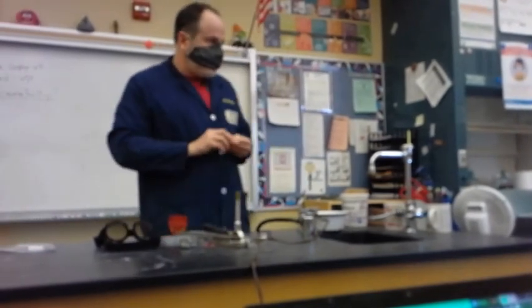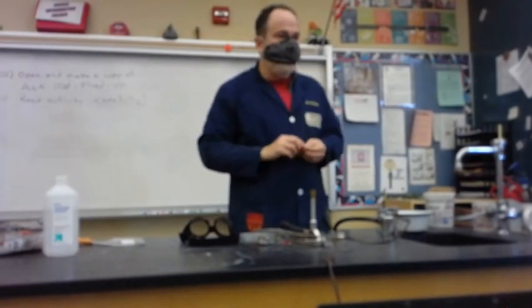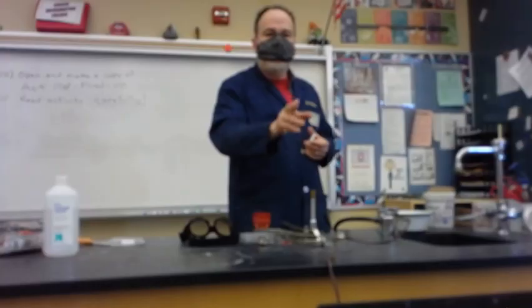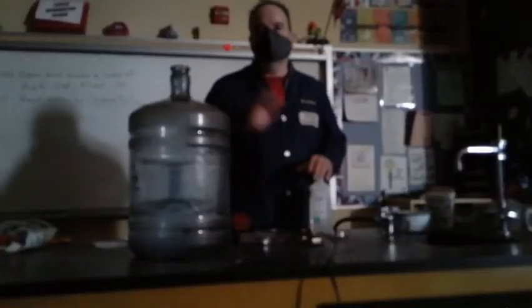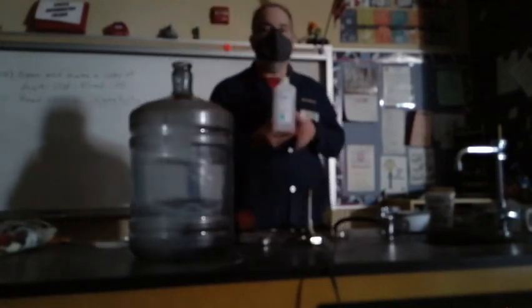So take a minute and go ahead and write down those things, all right? Take a minute. And we're going to stop each one. So the next demonstration is called the water bottle. And it involves a Sparkletts water bottle and some isopropyl alcohol.